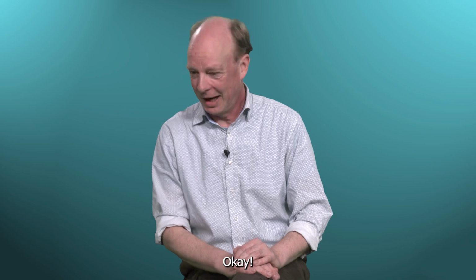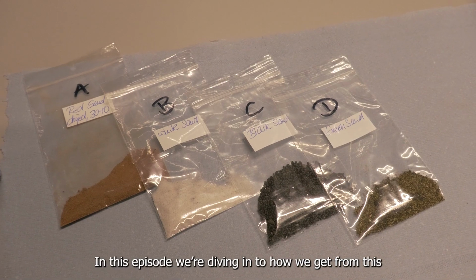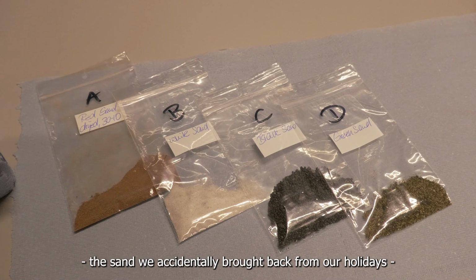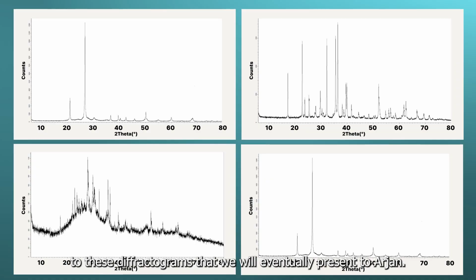Let's go. Okay. In this episode, we're diving into how we get from this, the sand we accidentally brought back from our holidays, to these diffractograms that we will eventually present to Arjan. What is it that we are seeing on these graphs?